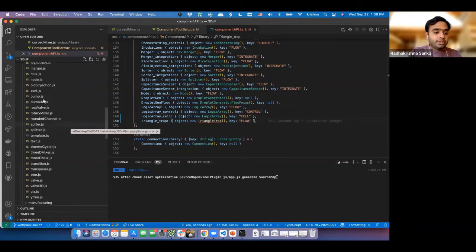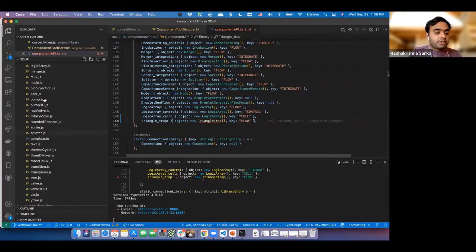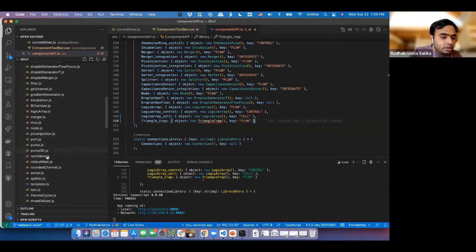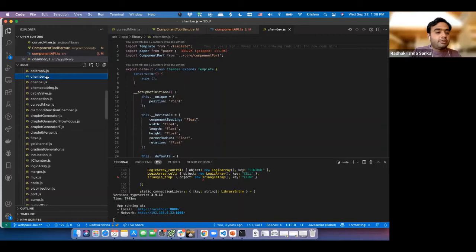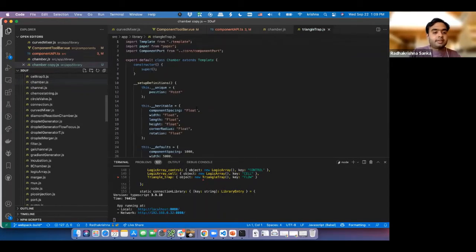So what we're going to do now is quickly go here. Okay, it's just going to flag an error. I'm going to pick the easiest thing we want to move, maybe the chamber. So we're going to take chamber.js and copy paste that, and I'm going to call this triangle trap. Then I'm going to go in here and say triangle trap.